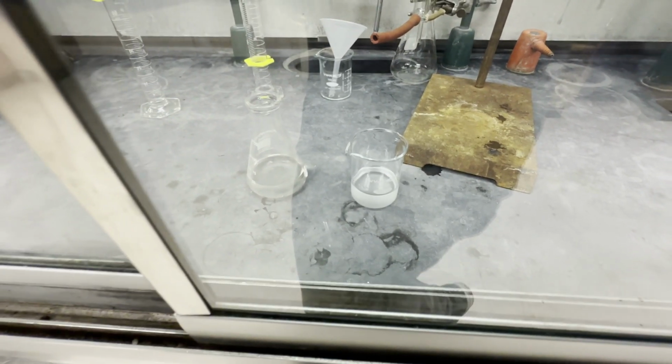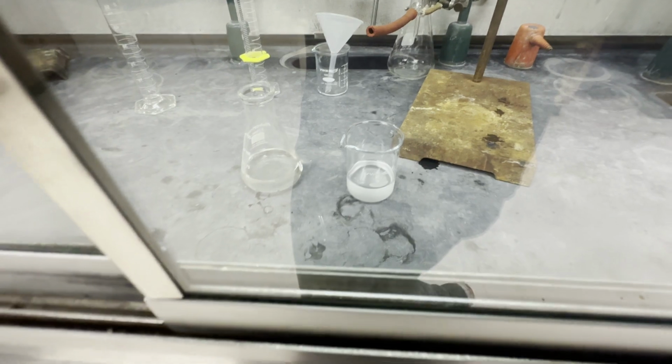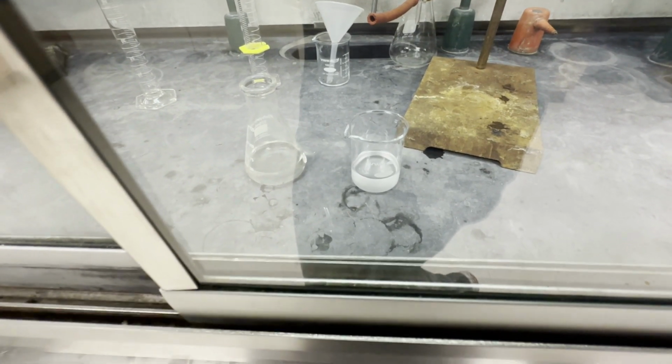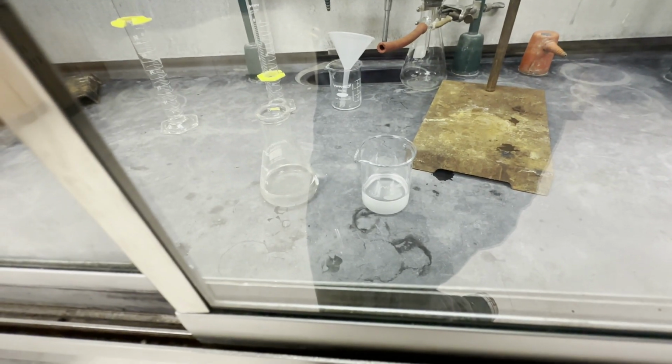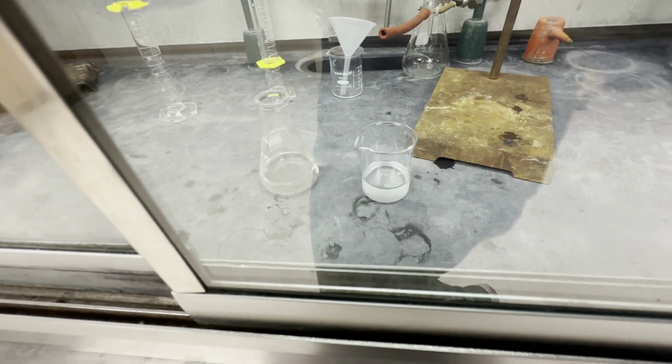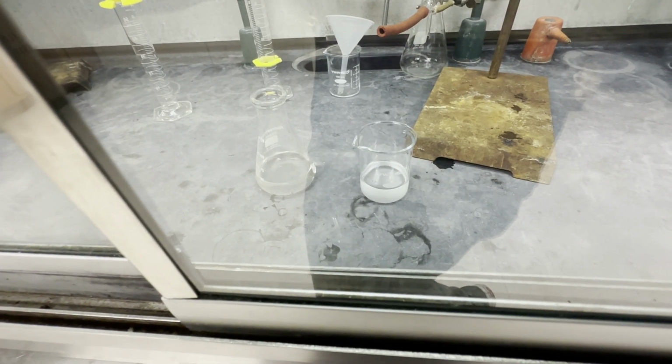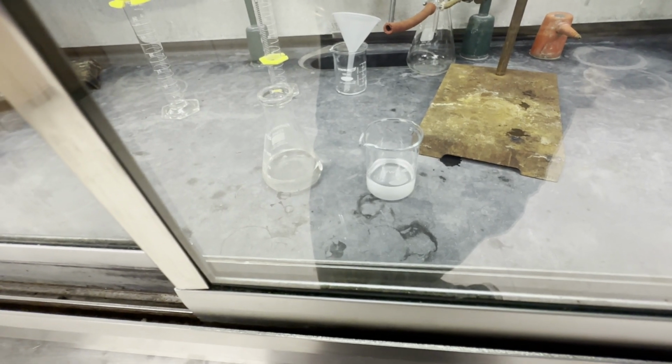Now that we have successfully, hopefully, extracted the naphthalene, which should be in the Erlenmeyer, in the organic DCM solvent, and we've separated our unknown from the naphthalene, now we need to get the crystals somehow. So first, with the DCM, we're going to use something called sodium sulfate to act as a drying agent and suck out any water possible.